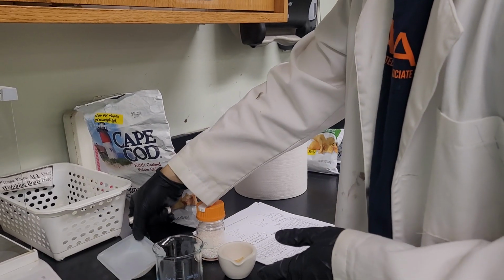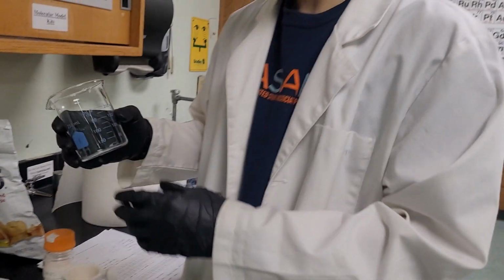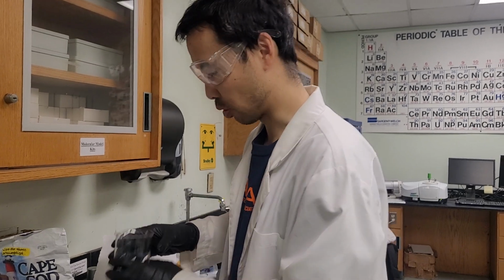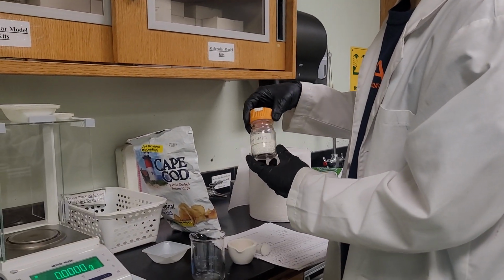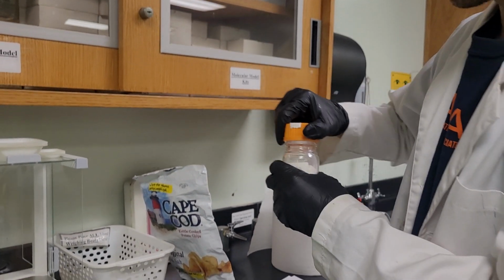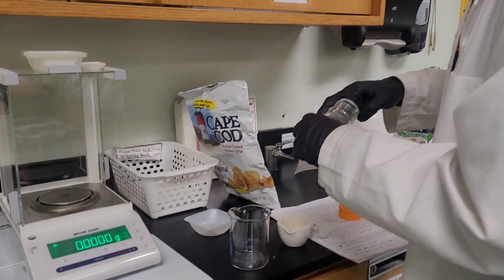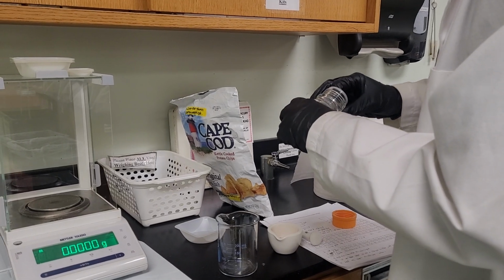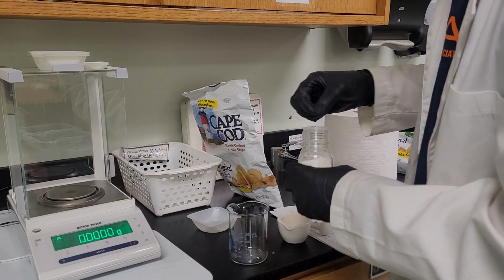As I said earlier, we're going to also record the mass of the beaker with some boiling chips, because we are going to eventually boil off some of that petroleum ether. So these are boiling chips. We're going to add 1 or 2 inside and record the weight of the beaker. And what the boiling chips do is help boil off the solvent. So we added 2 chips.